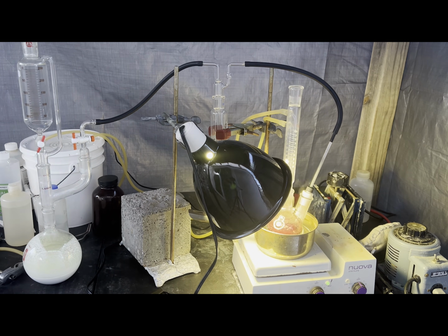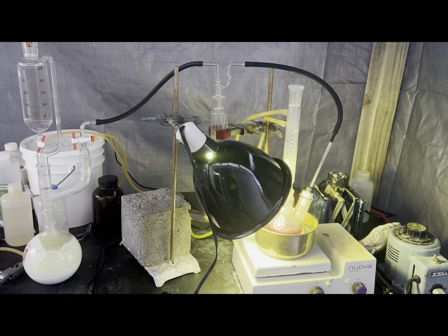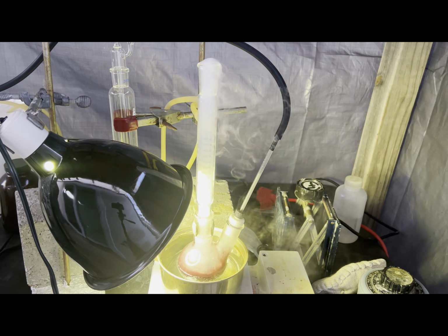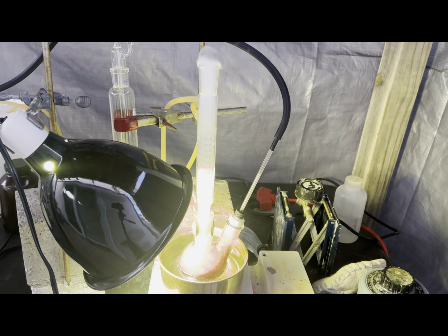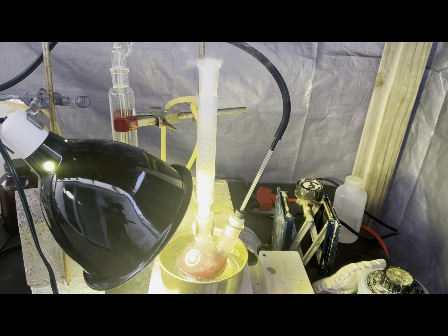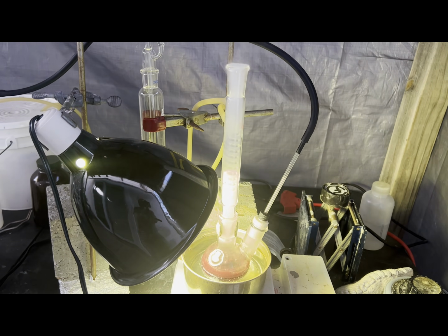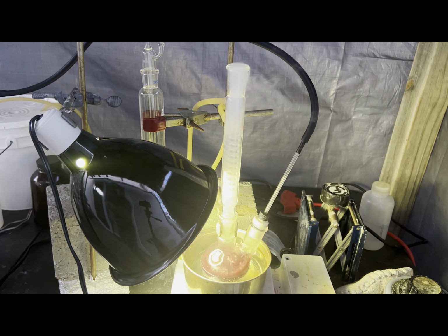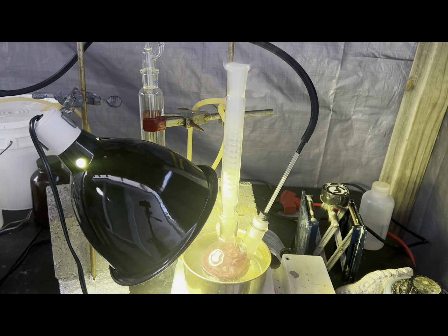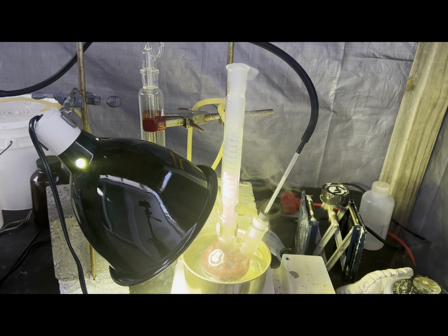The reaction vessel is heated by a boiling water bath and equipped with a condenser. When the chlorine is let into the reaction mixture, there's a lot of HCl being produced because the phosphorus trichloride formed by chlorine reacting with the phosphorus immediately reacts with however much water is left in the glacial acetic acid. It's super annoying to make anhydrous glacial acetic acid, so I didn't bother. Once all the water reacted, the HCl fumes more or less disappeared or were minimal enough that they didn't fume in the air, visibly.